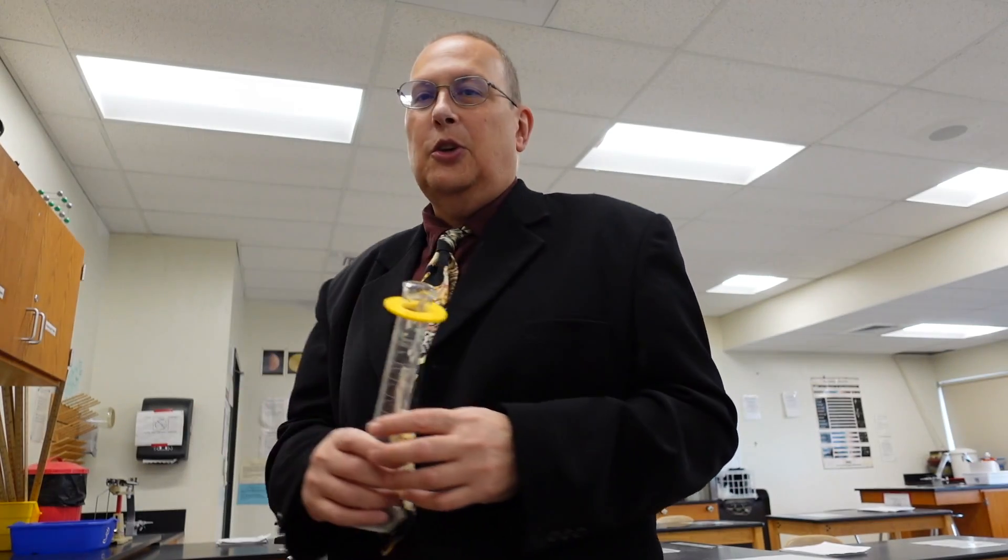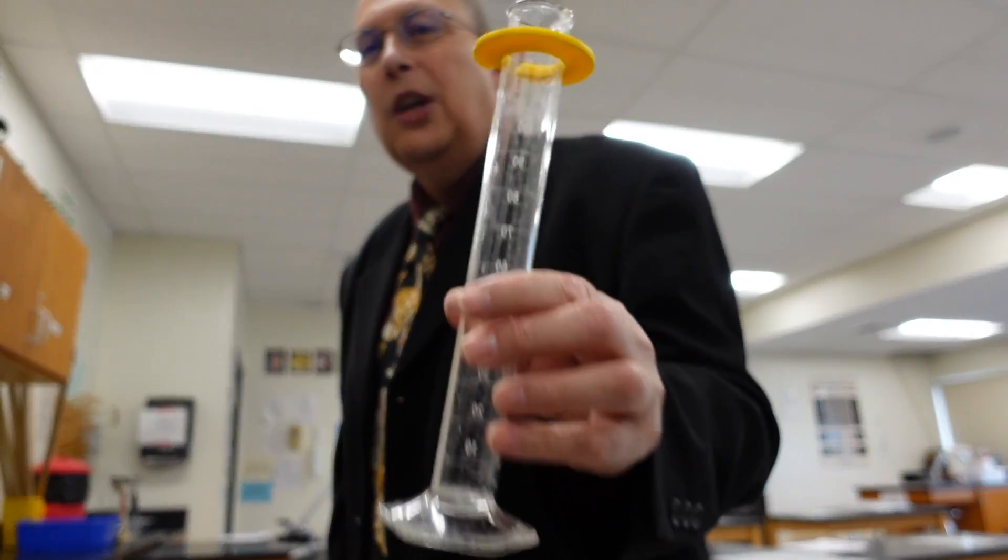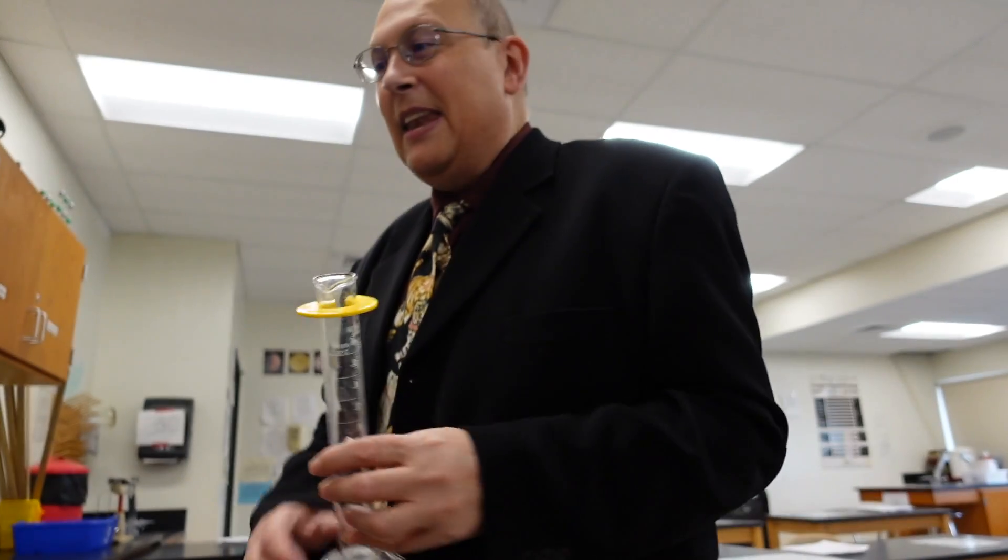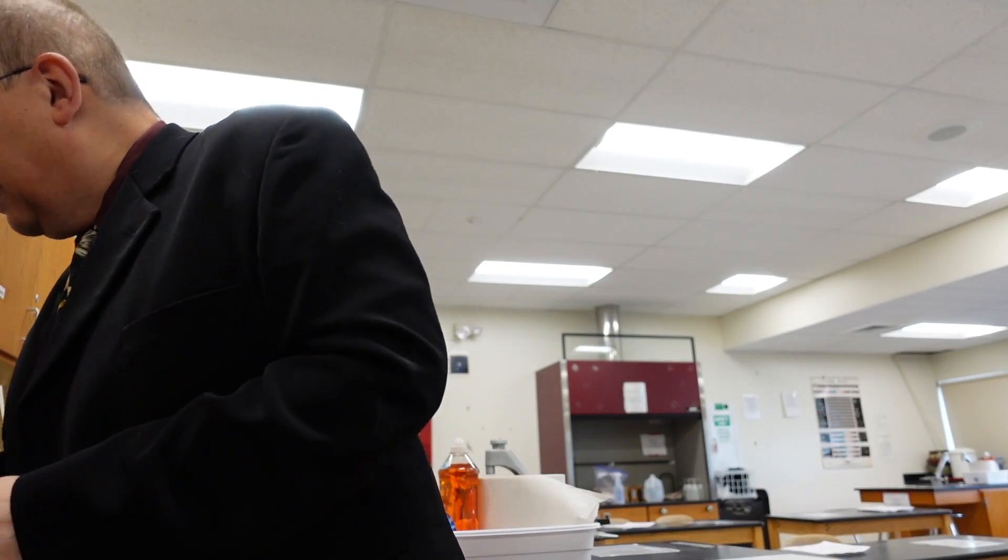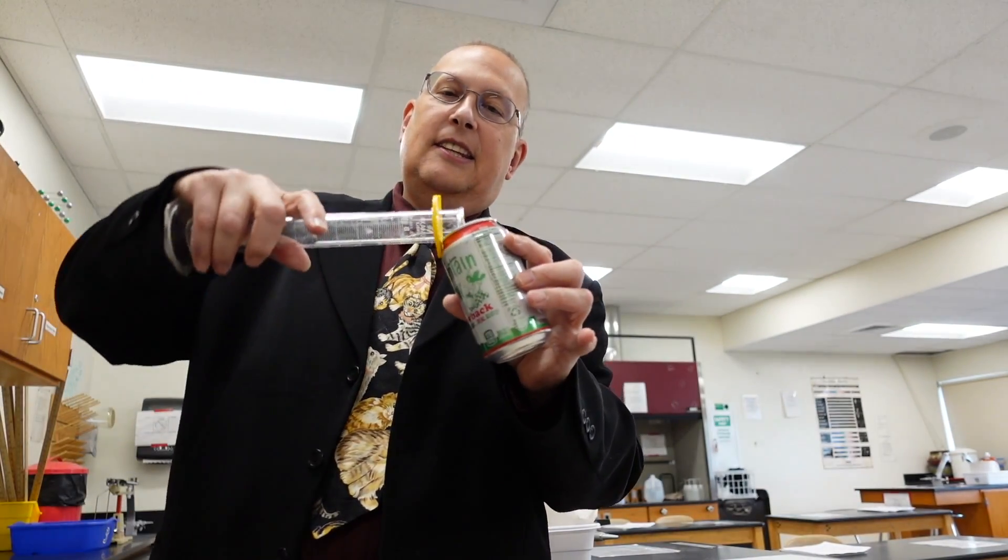Now, how much water you put in here—anywhere between 80 and 100, I really don't care. You don't have to get it exact. So what I'm going to do is I'm going to fill this up with a certain amount of water. I'll show you what the volume is so that you can record it. Now we're going to take that water and we're going to place it into this calorimeter can.